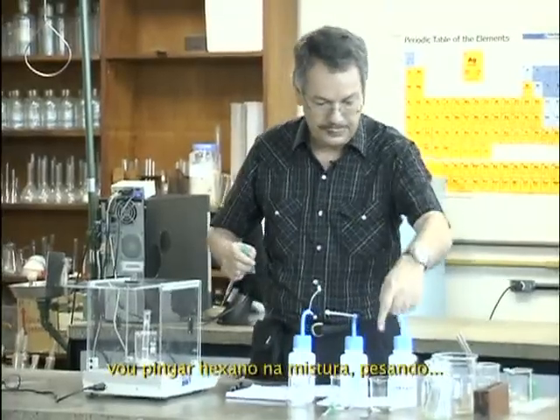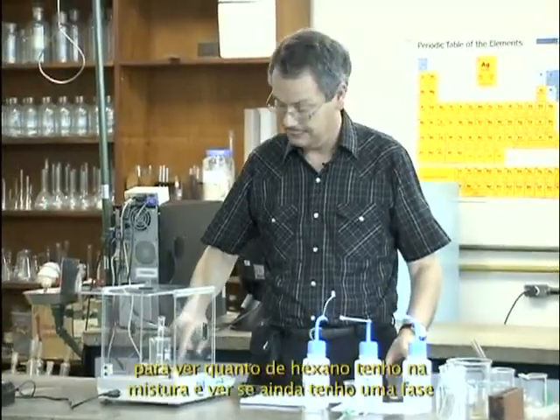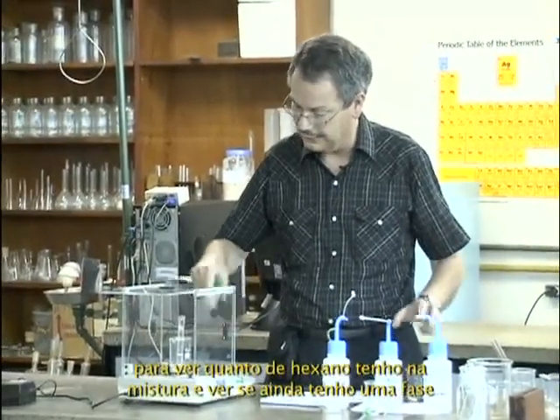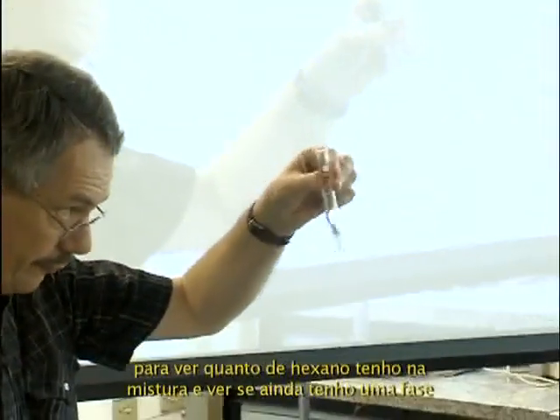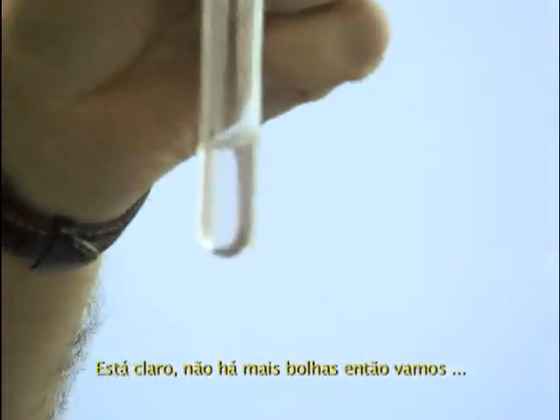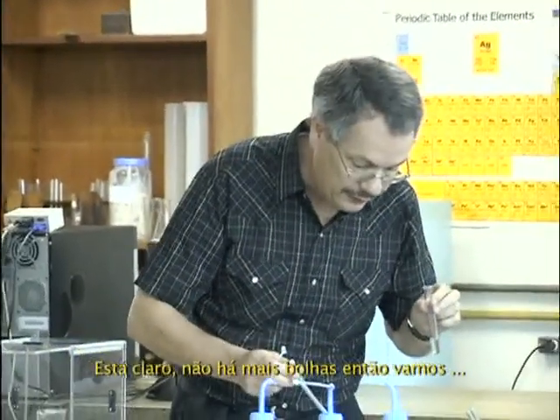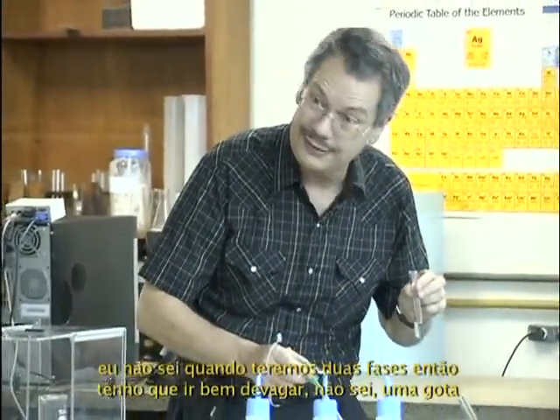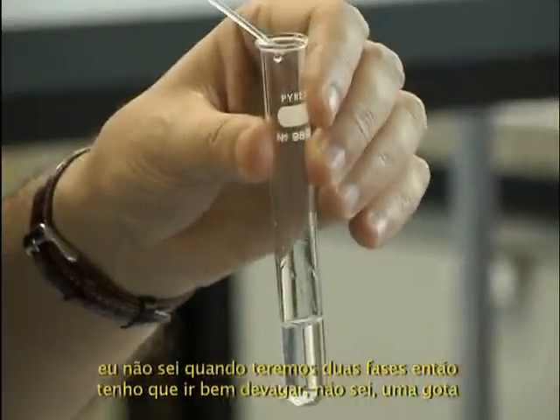I will drop hexane in the mixture, weighing it. So I'll weigh how much hexane I have in my mixture to know when it's one phase. So I guess now it's clear, no more bubbles. So let's take, I don't know when it will make two phases, so I have to be very slow, one drop.